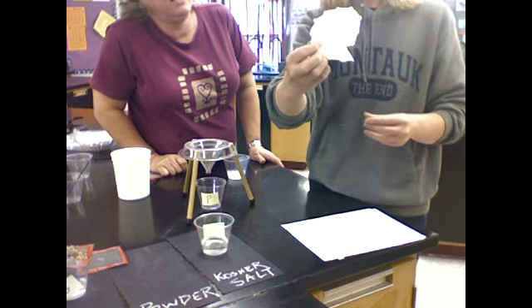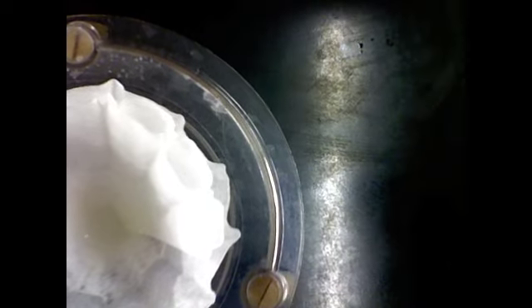And I'm noticing that there's white powder sticking to the sides of the paper filter. Let me just bring this over so our audience can see that as well. So if you can see, there is powder stuck to the sides of the filter paper. I'm going to put my reputation on the line, Miss Stilfen, and say, I think the paper filter worked with the powder. It definitely worked for the powder. I agree. I would stake my reputation on that as well. And what's kind of neat is there's this beautiful little pattern that's formed. I'm going to bring that up for people to see.